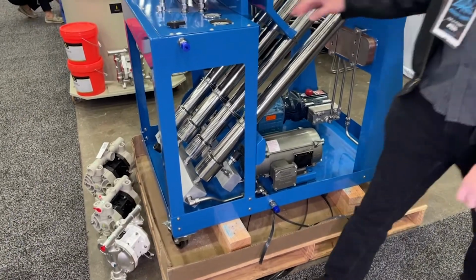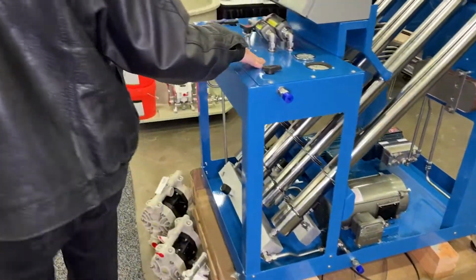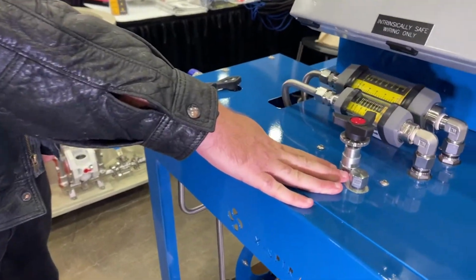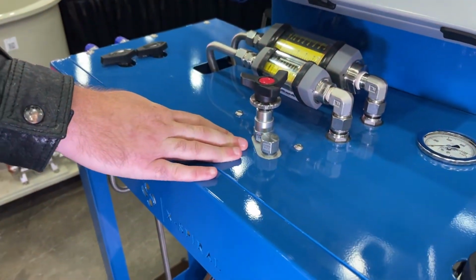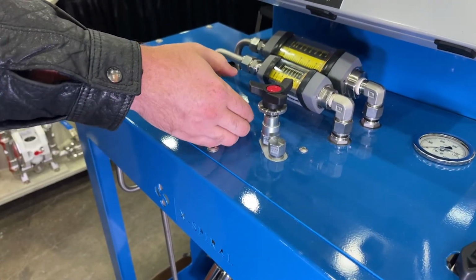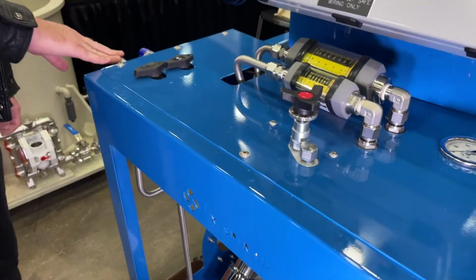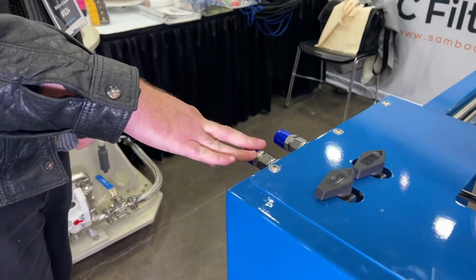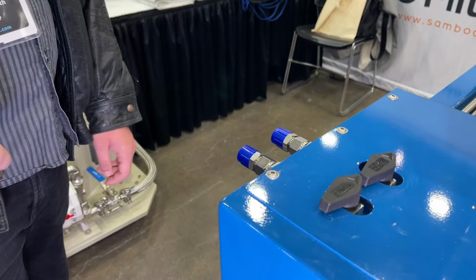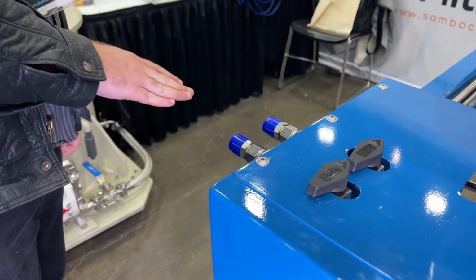Any fluid leaving the system will leave by passing over the high pressure relief valve, which will control the system pressure. Fluid that exceeds the system pressure will leave through the concentrate port, and fluid that passed through the filter to be filtered into clean solvent will leave the permeate port.